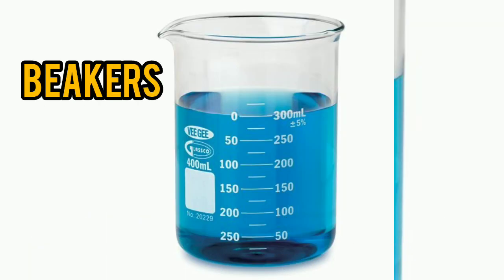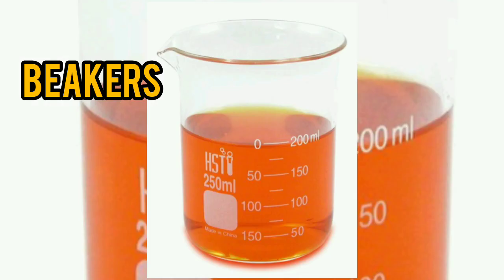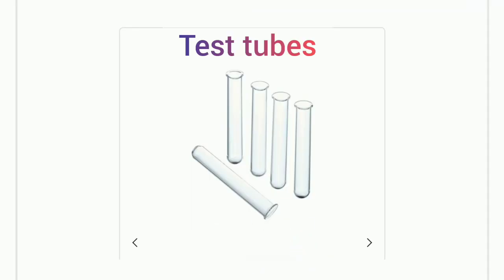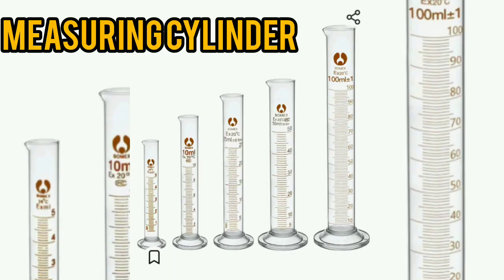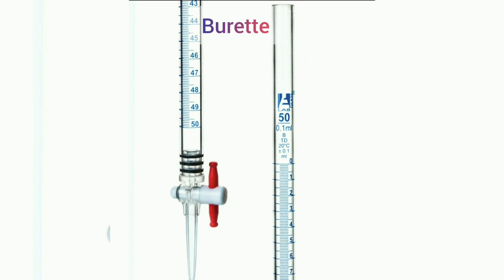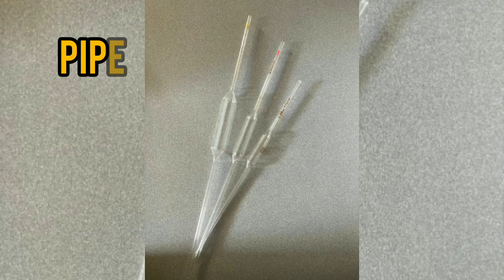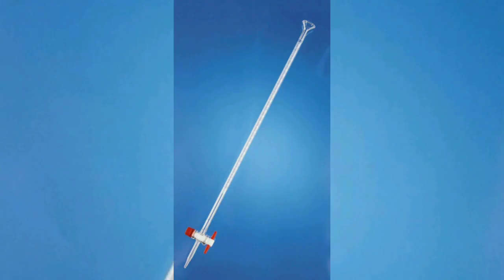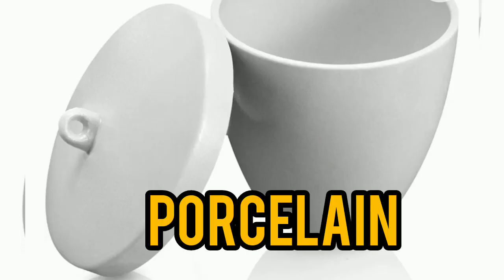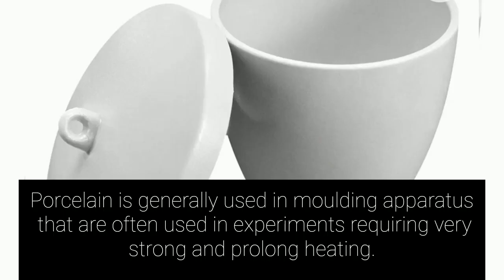One, we have the beakers. Beakers are made up of glass. We have the flask. We also have test tubes. We have measuring cylinders, though some of them are made up of plastic. We also have burettes. We have the pipette. We have what we call the bell jar. We also have the thermometer. So having a look at glass, let's proceed to porcelain.